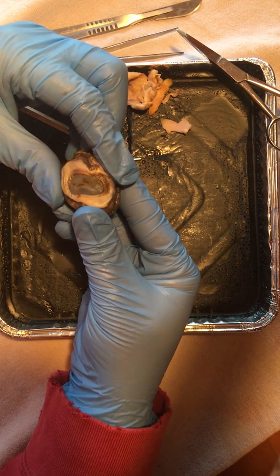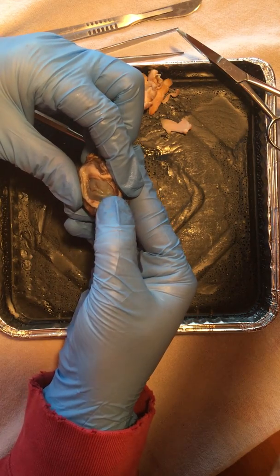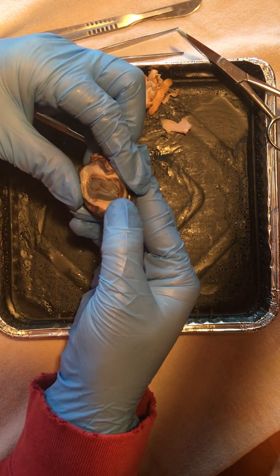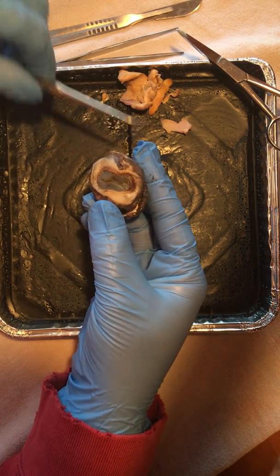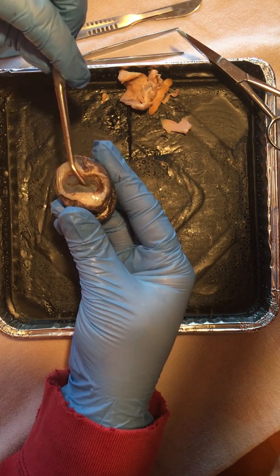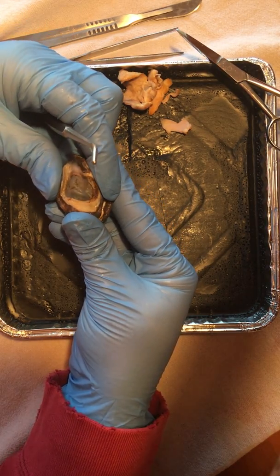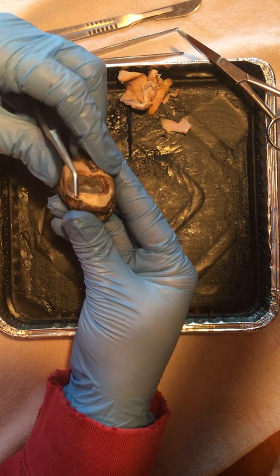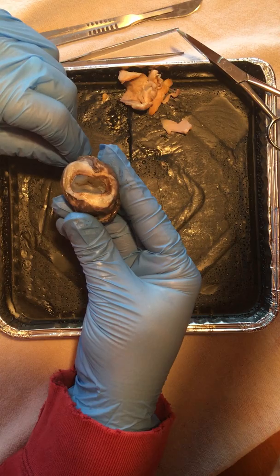Something to note right on the exterior portion of this eye is the cornea. Here in death and with a lot of preservatives, it's clouded, but in life it's actually quite clear. Something to note in cows and sheep as well is that their pupil is actually horizontal, where us humans have a round pupil. There's also the sclera, which is the white of the eye. That's going to be a little easier to see once we open that up.